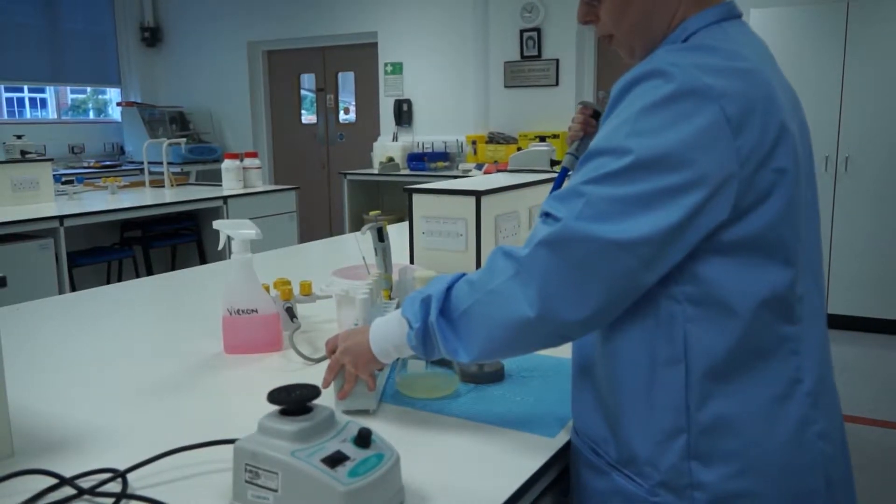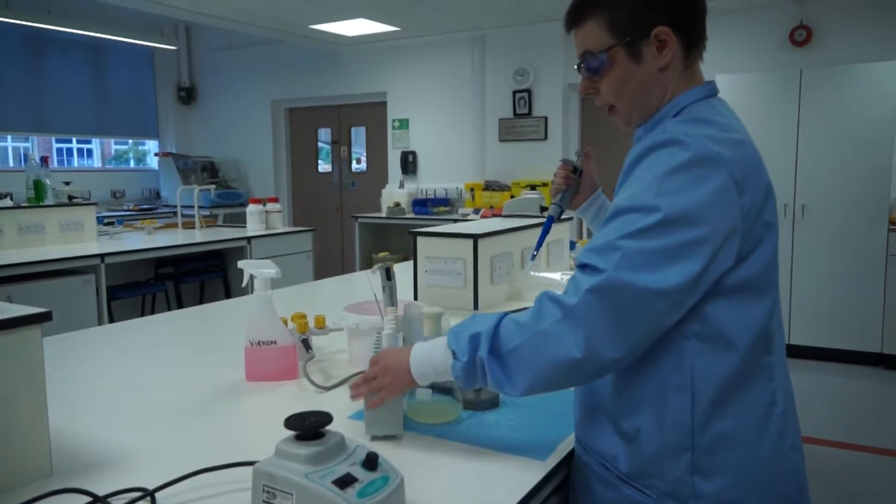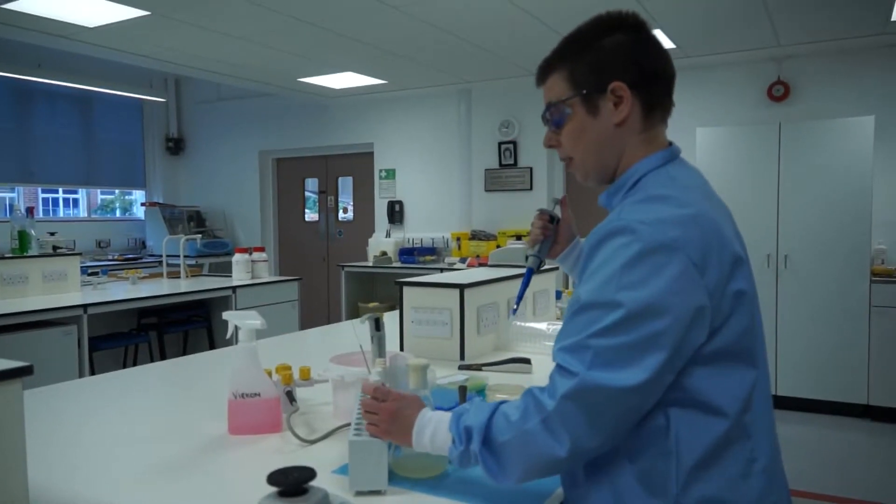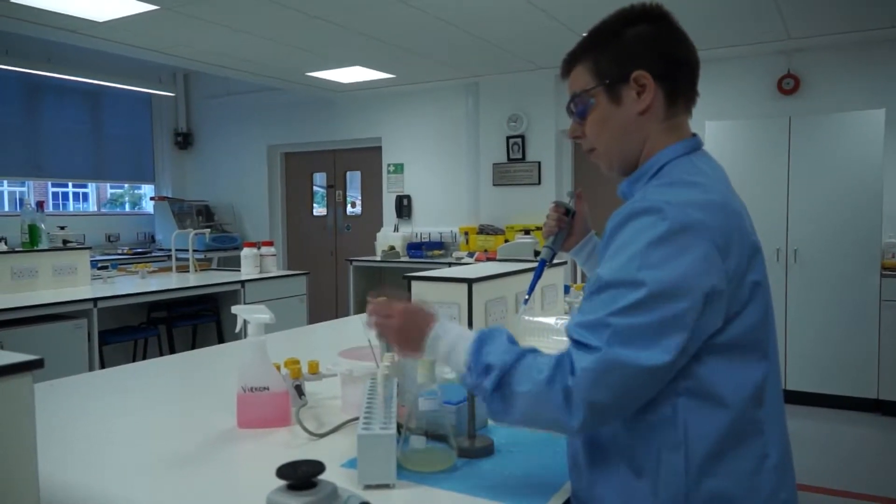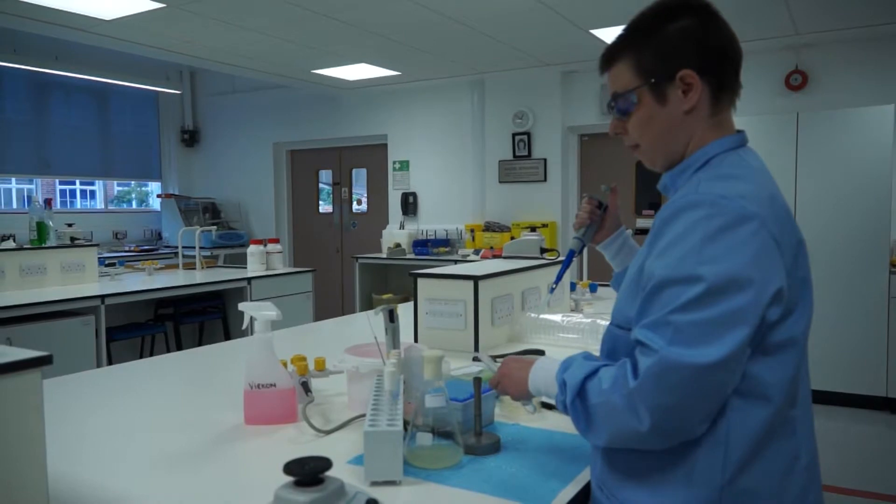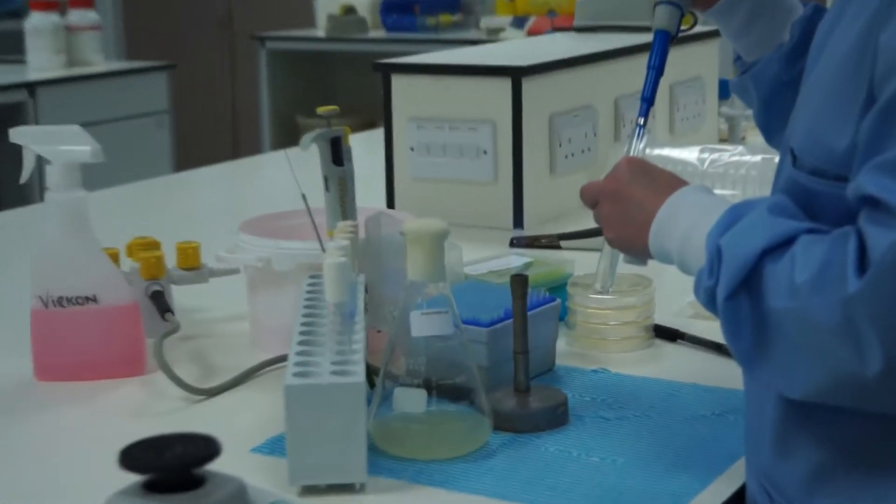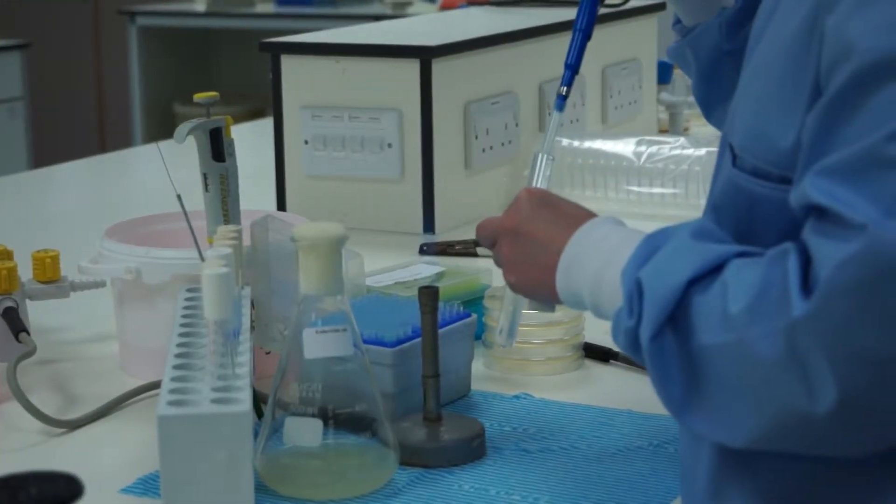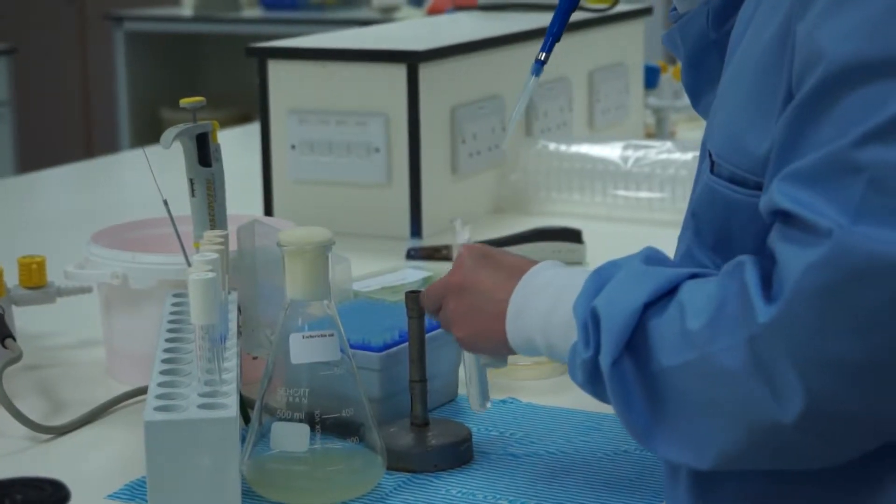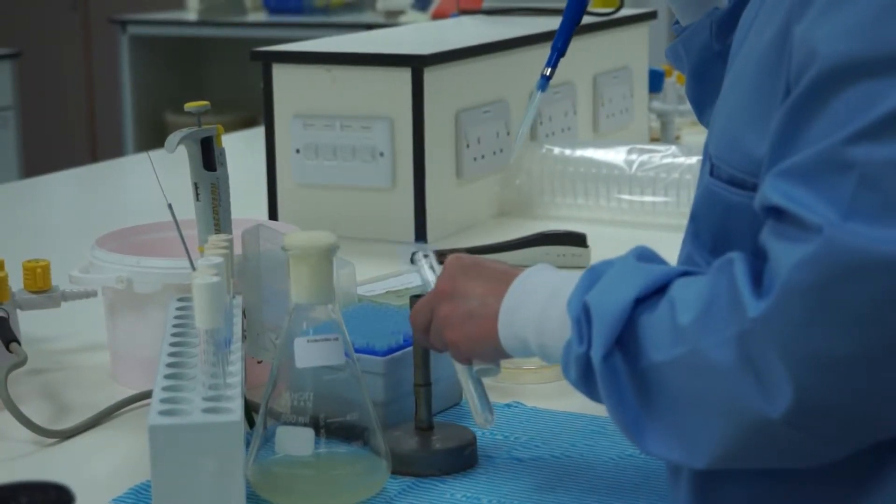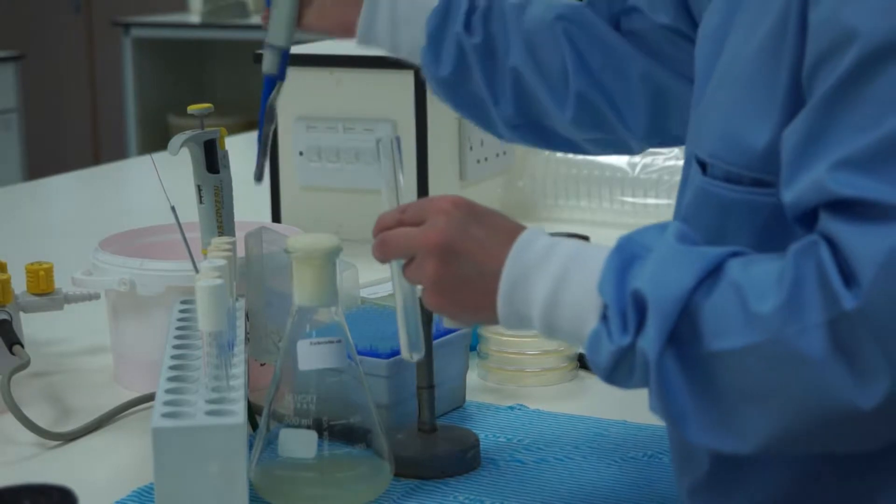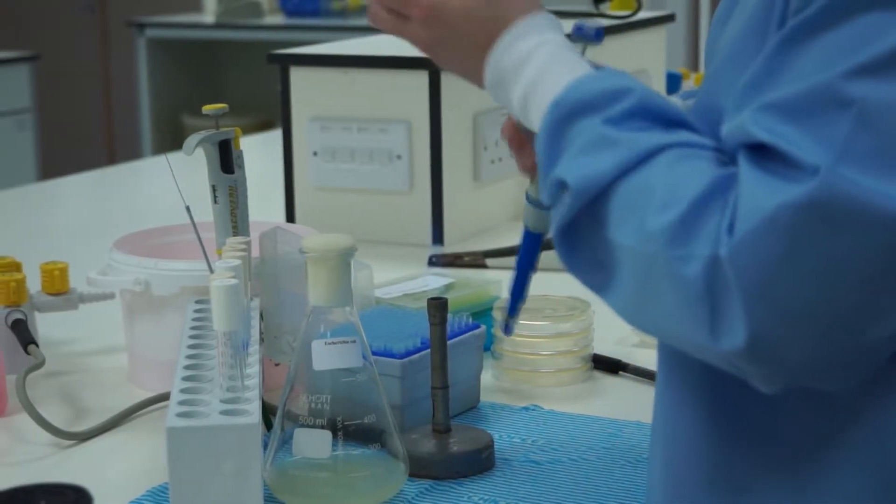Move in your tubes into your sterile area. Loosen the cap. Remove the cap. Flame the neck of the tube. Expel the liquid down to the second stop. Flame the neck. And replace the cap.